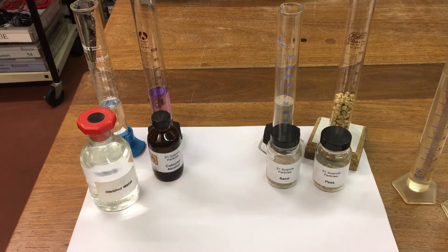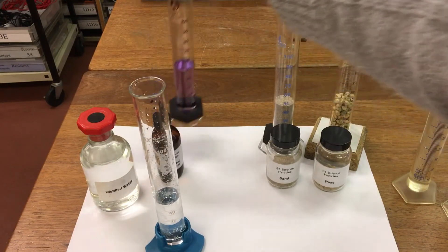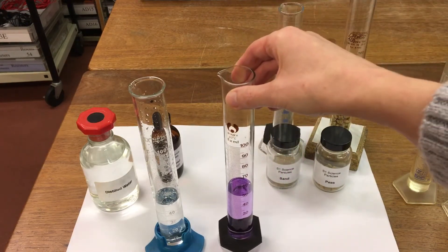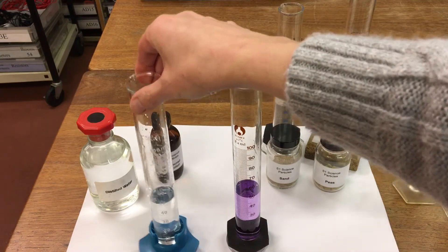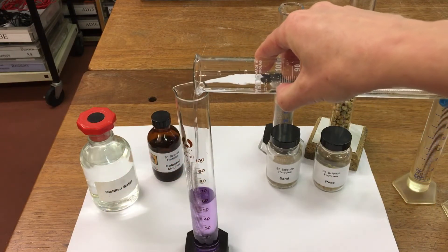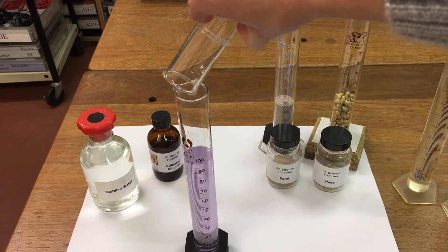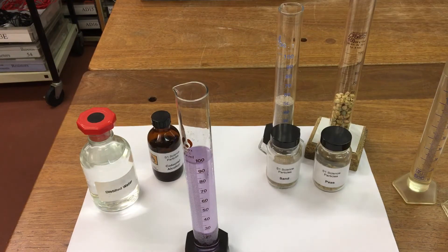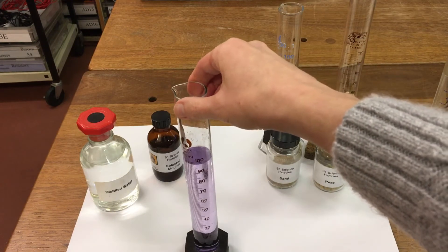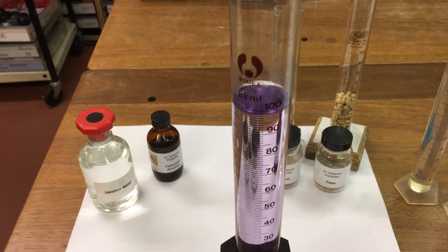Next, we're going to look at water and alcohol. So in this measuring cylinder, we've got 50 ml of water, and in this measuring cylinder I've got 50 ml of coloured alcohol. So I'm going to add the water to the alcohol. So 50 ml of water plus 50 ml of alcohol, and we've got about 98 ml in total.